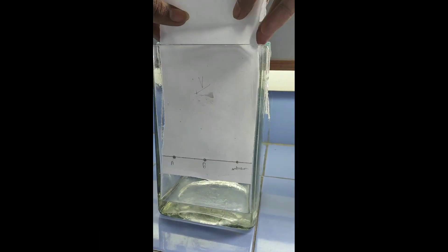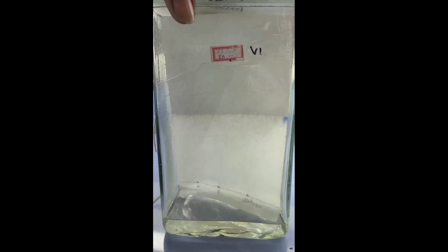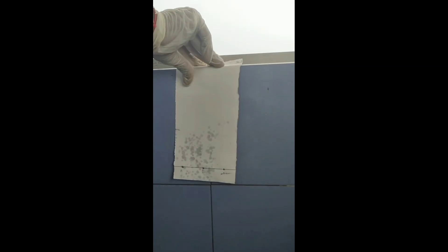After spotting, dry the paper in a hot air oven for 1 minute. Place the paper inside the chromatography chamber and close the tank with the lid. Allow the solvent to flow for about 30 to 45 minutes. After 30 to 45 minutes, take out the paper and allow it to dry for a few minutes. After drying, spray the detecting agent — the detecting agent used here is concentrated HCl with phloroglucinol.